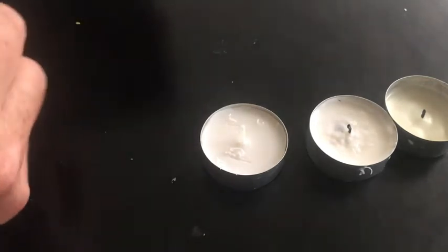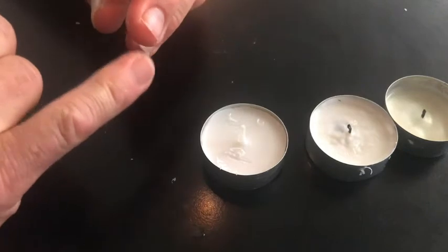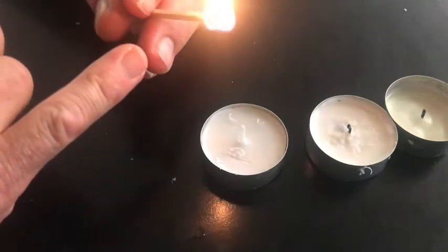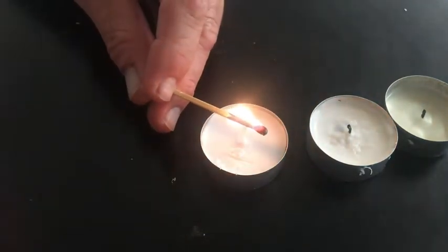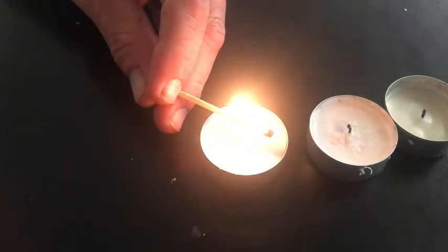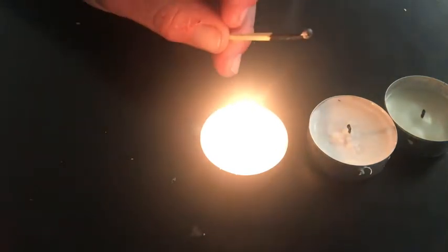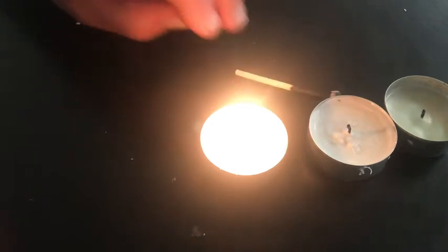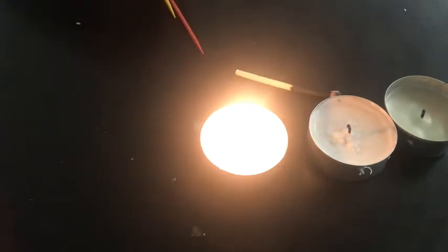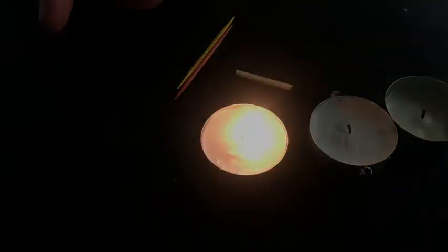So let's light our match. Not only is the head changing, usually there's a different smell than just the wood. If you just smell the wood, it doesn't have that same sulfurous smell. And I'm going to light the candle, which is something you need to do. And when you light the candle, you want to keep a match. So we don't really want the match head to burn all the way down. However, you're supposed to have several matches. And if you don't have matches, you can have toothpicks available to do the rest of this lab. Let's adjust the lighting. There we go.